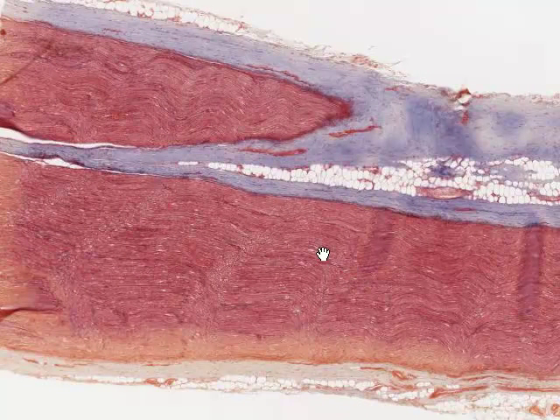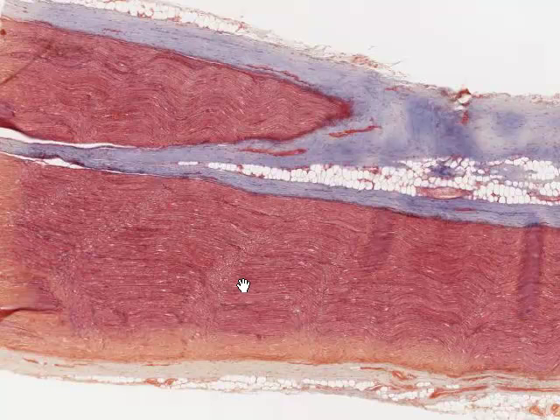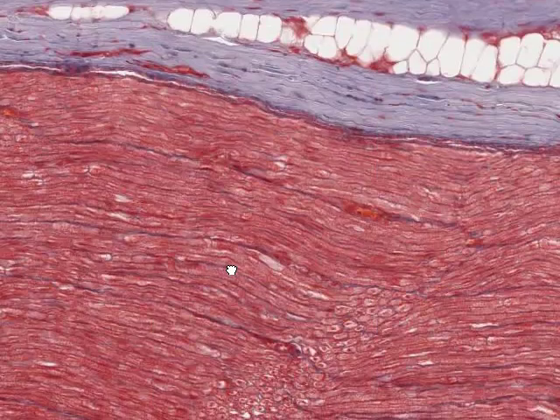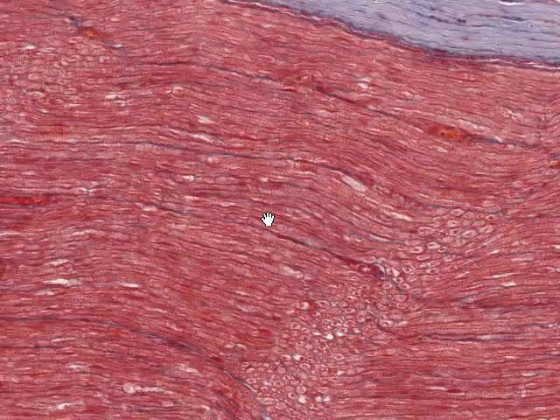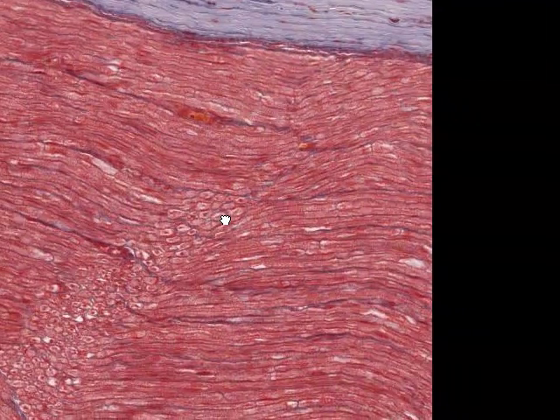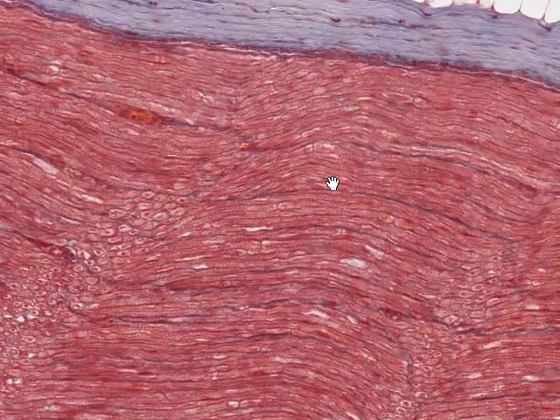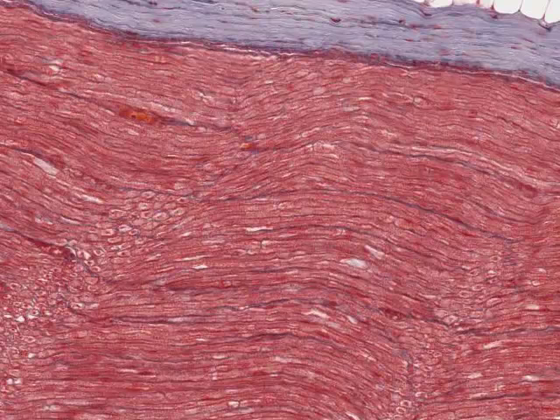One thing you may notice immediately is that the section appears quite wavy. This is a very characteristic appearance of peripheral nerve in longitudinal section, and we'll use it as a diagnostic feature later when looking at peripheral nerve stained with hematoxylin and eosin. Recall that myelin isn't preserved in peripheral nerve specimens prepared the traditional way, because myelin is soluble in the organic solvents used to prepare tissue and washes out. What we're left with is the endoneurium surrounding each nerve fiber and the remains of axonal proteins, but no actual myelin.